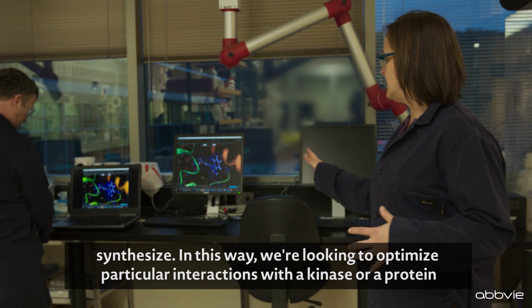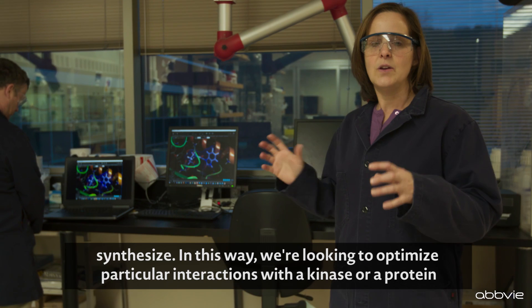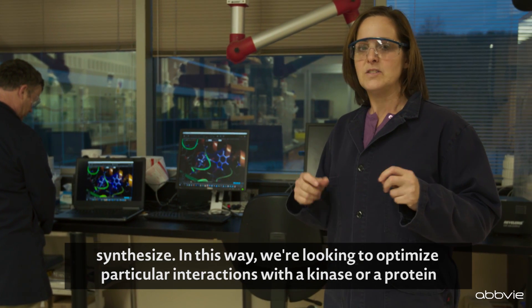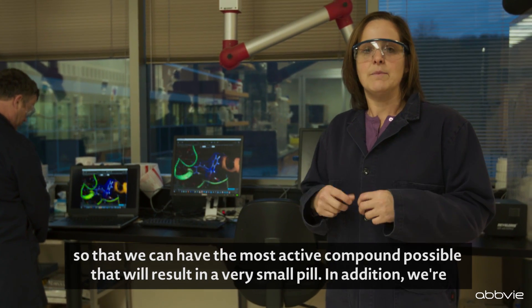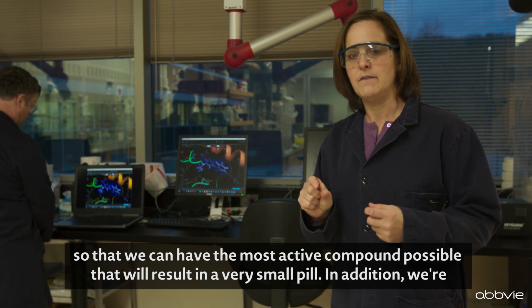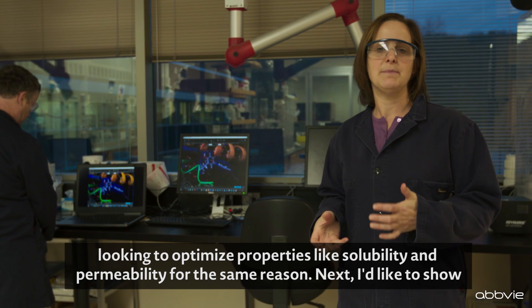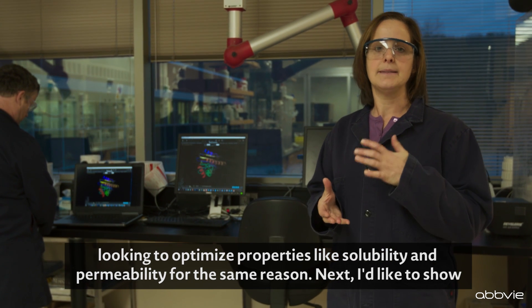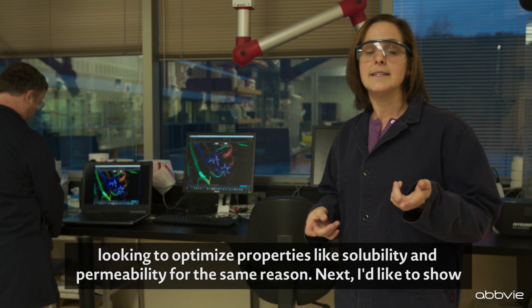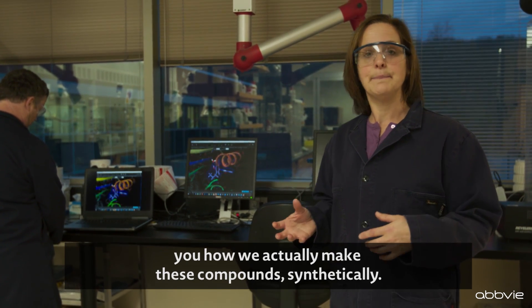In this way, we're looking to optimize particular interactions with a kinase or a protein so that we can have the most active compound possible that will result in a very small pill. In addition, we're looking to optimize properties like solubility and permeability for the same reason. Next, I'd like to show you how we actually make these compounds synthetically.